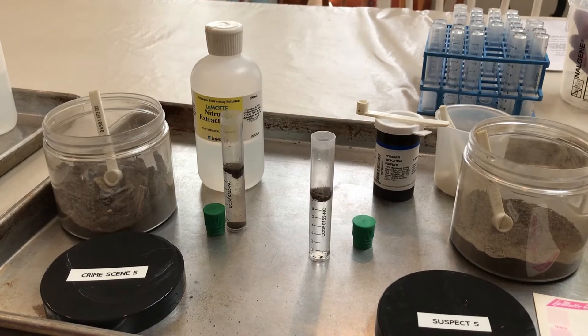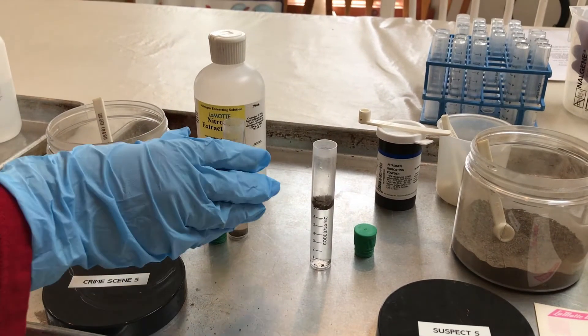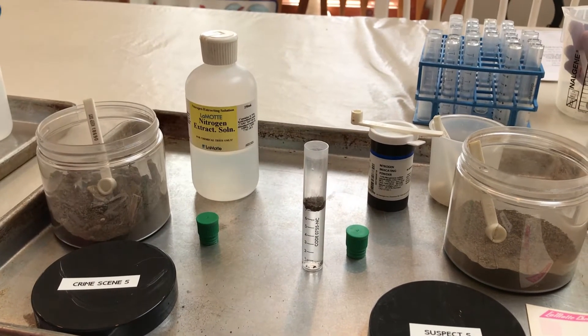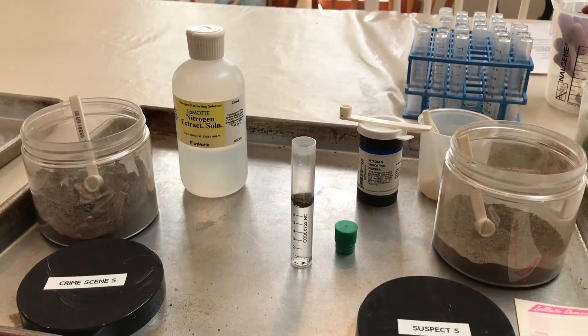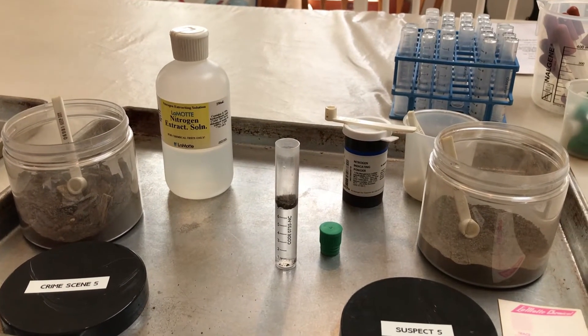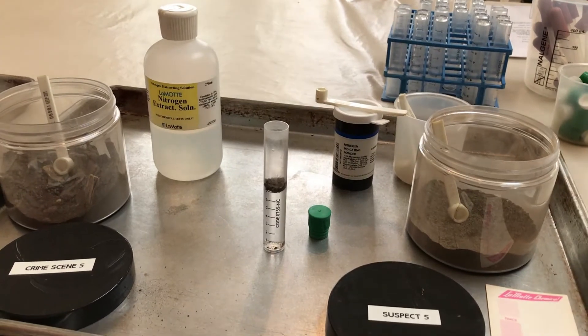So what we're gonna do is cap it and then shake it, and then we let the soil settle out. The liquid at the top is what we're after, and we're gonna use that to test for the nitrogen. So stand by for part two.